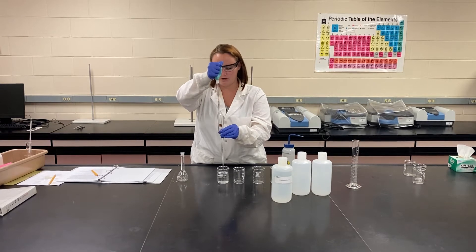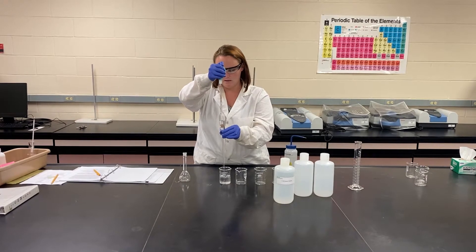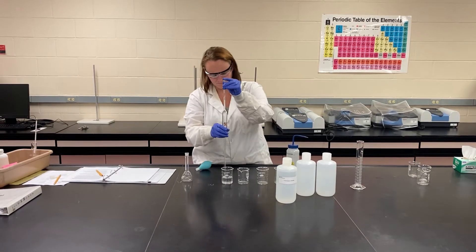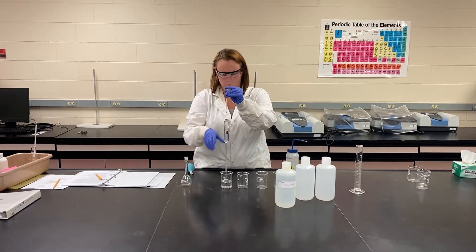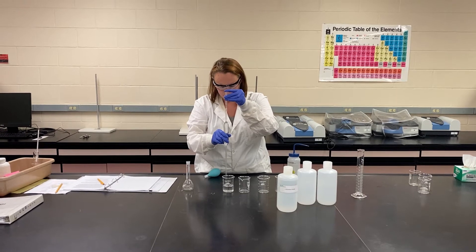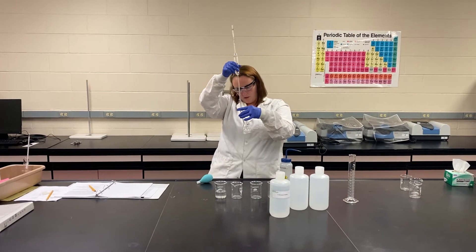The way we do that is we use our 50 mL pipette, which is our most accurate piece of glassware. Remember, as we talked about with the glassware, you may have to re-squeeze your bulb in order to actually get past the marking. Then if you go too far down, you're going to re-squeeze your bulb until you make it to the line. Now the bottom of my meniscus is on that indicating line, and we release into our 100 mL volumetric flask.